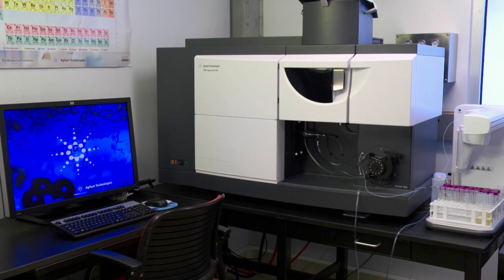This is the first in the series of Agilent instructional videos to help you maintain the best performance from your ICP-OES. We'll begin with problem diagnosis.